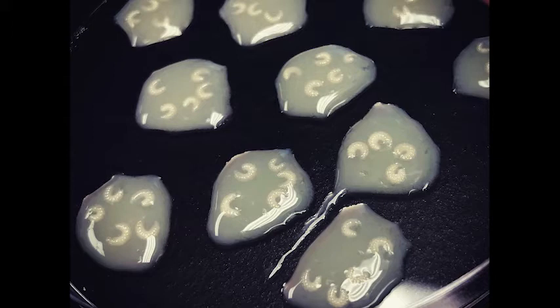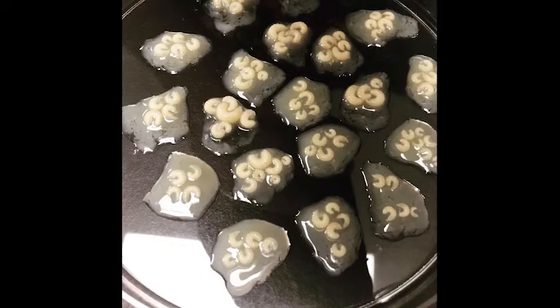While a worker bee would be inspecting these, grooming them. If a larvae was sick or dying, they would be removed by hygienic bees. It's much more difficult for us to tell if a bee larva is sick or dead until it becomes kind of too late and fungus starts to grow out of them. So we have to be really careful. Again, we can see another example of what that looks like.